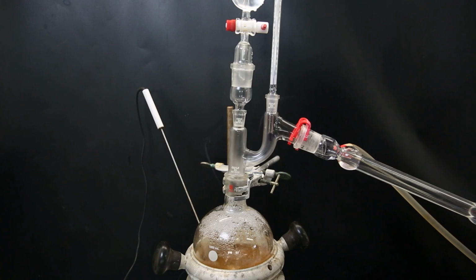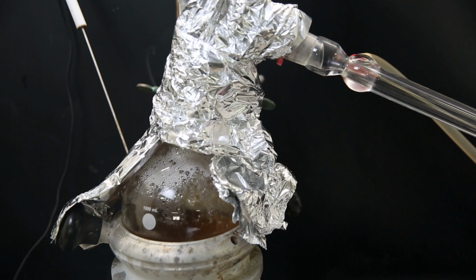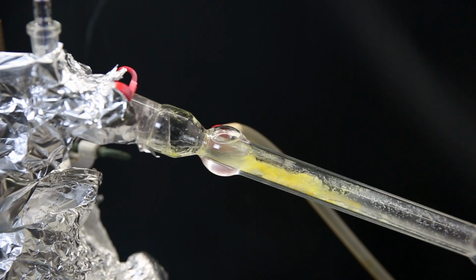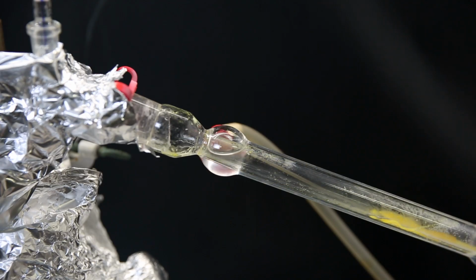I added 150 ml of a 10% sodium hydroxide solution to the solid, and then opened up a steam generator to start steam distilling over the 2-nitromesitylene. Since 2-nitromesitylene is a solid at room temperature, it will usually solidify in the condenser, unless it is supercooling. To make sure it comes through when it solidifies and doesn't block the flow in the condenser, I occasionally turn off the condenser, until all of it liquefies and flows into the receiving flask.